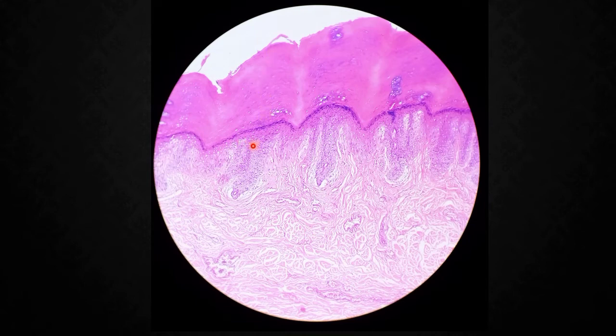If you remember the layers of the skin, you can write stratum basale, then stratum spinosum. After stratum spinosum, we can identify stratum granulosum. These are the keratohyalin granules. Then after that, the stratum lucidum, this thick keratin sheath. Then above the lucidum, you can identify stratum corneum. So these are the layers you can write. So five layers can be seen in the epidermal cell layers.